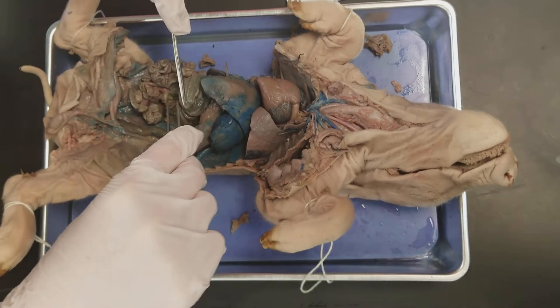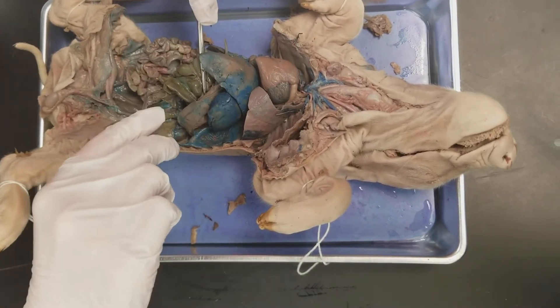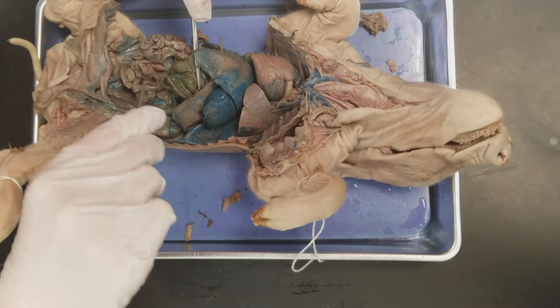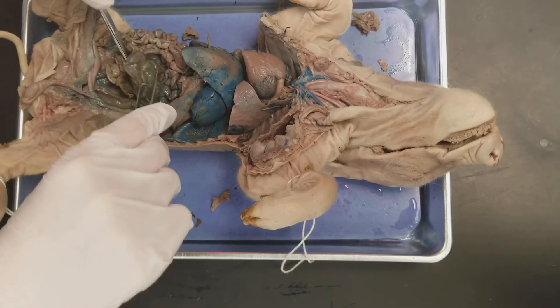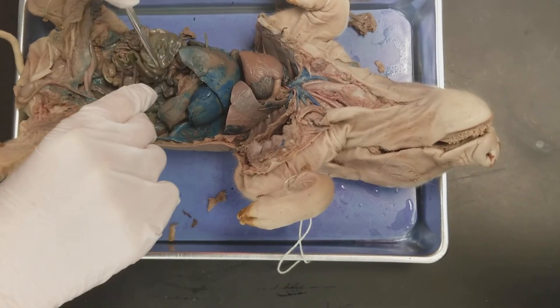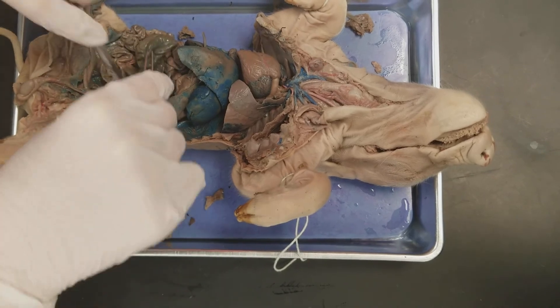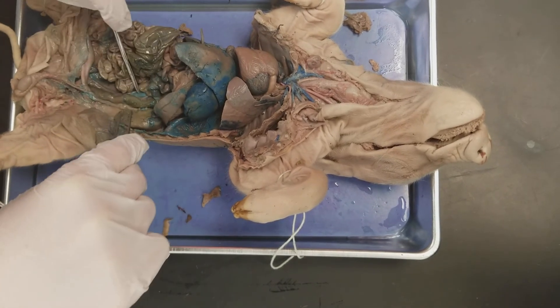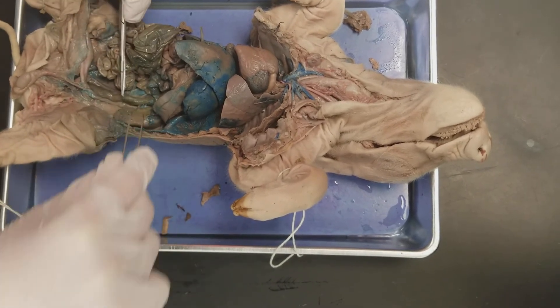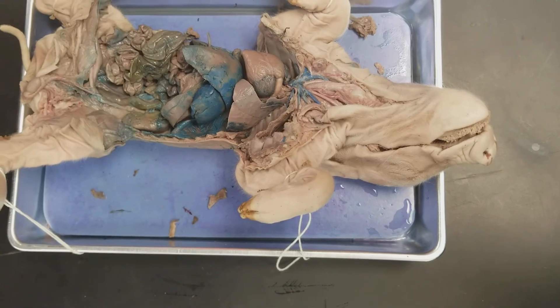The cecum is this little pouch that sticks off of the beginning part of the large intestine. And this whole thing is just the large intestine and the colon. Then it ends and goes into the rectum, which is this portion right here.